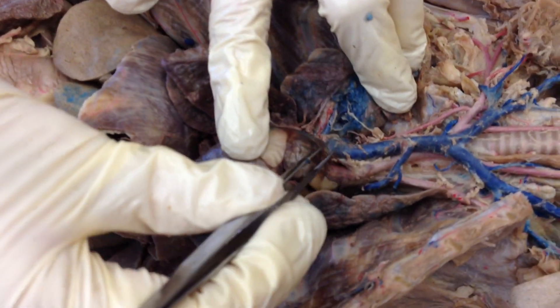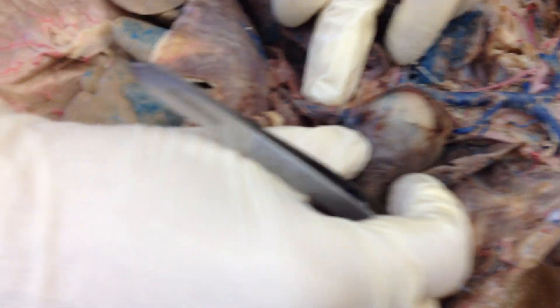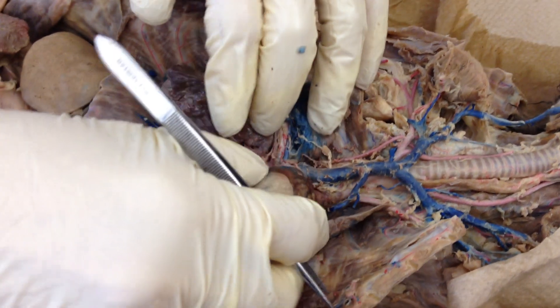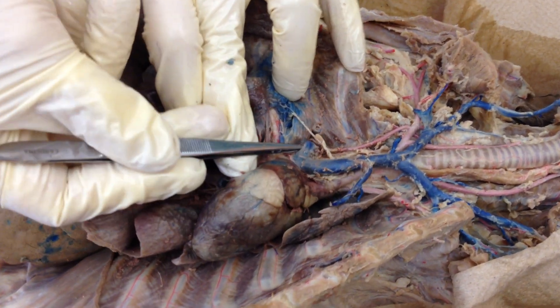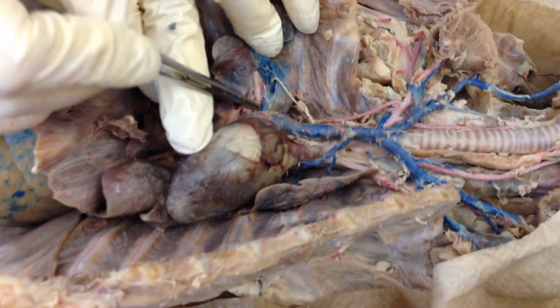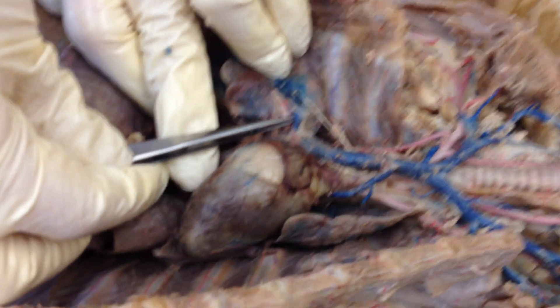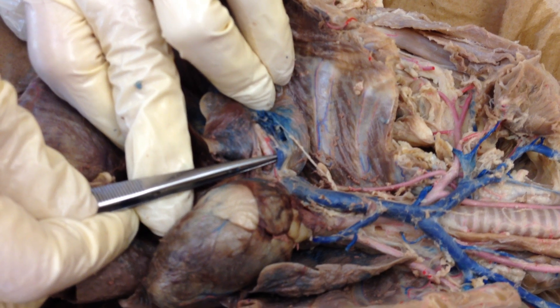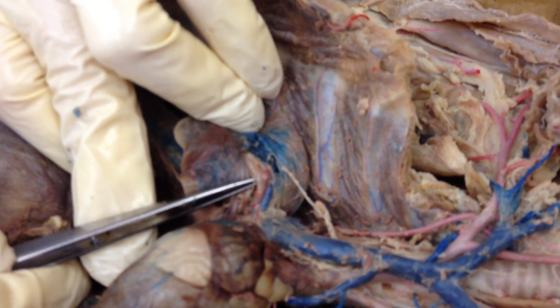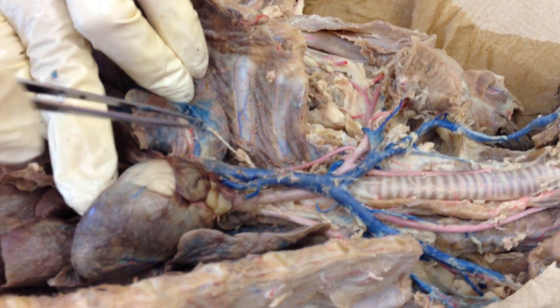If you look over on this side, you can see this very large blood vessel — that's going to be your superior vena cava. If you look underneath on the other side, this is your inferior vena cava, which comes into the right atrium. The superior vena cava also goes into the right atrium. Notice this very large blood vessel here — that's called the azygos vein; it's the first big branch coming off the superior vena cava. These vessels going into the lungs: the pulmonary artery is blue, carrying deoxygenated blood from the heart to the lungs, and the pulmonary vein is red, carrying oxygenated blood from the lungs back to the heart. In systemic circulation, veins are blue and arteries are red — opposite in the lungs.